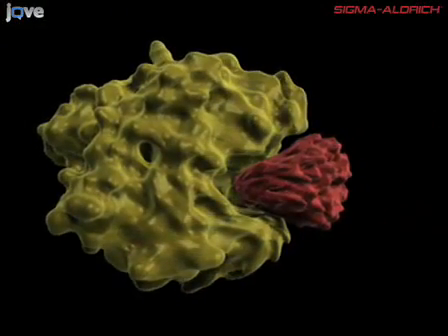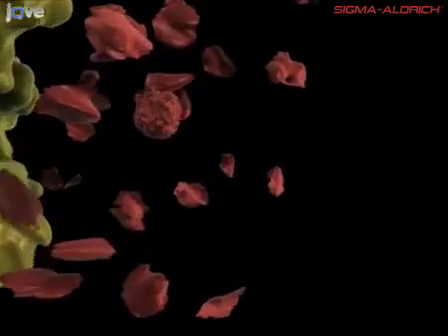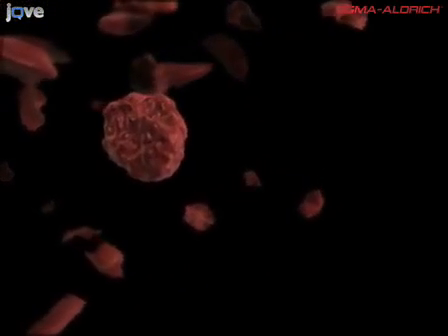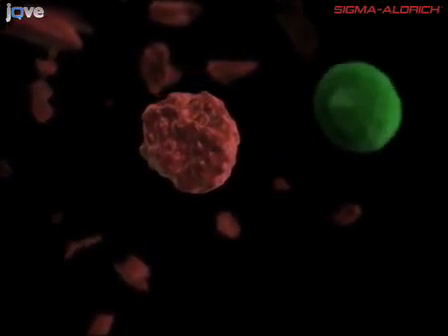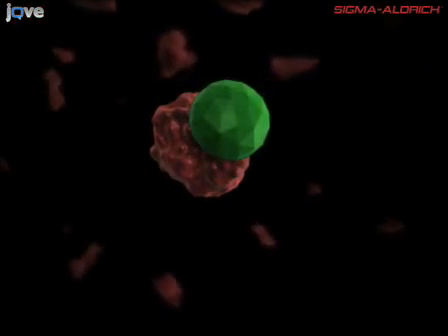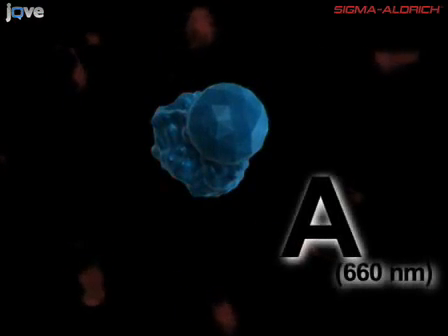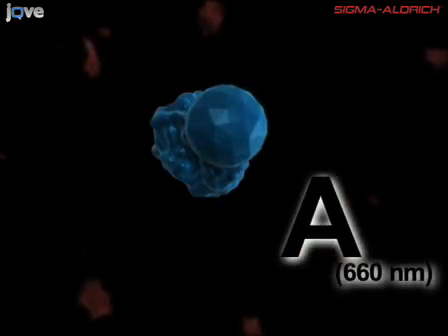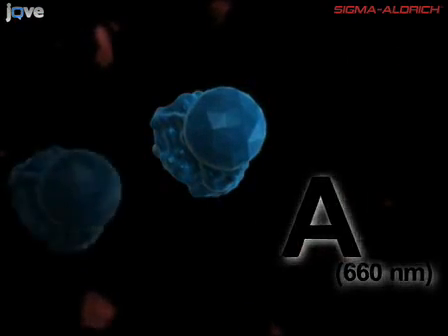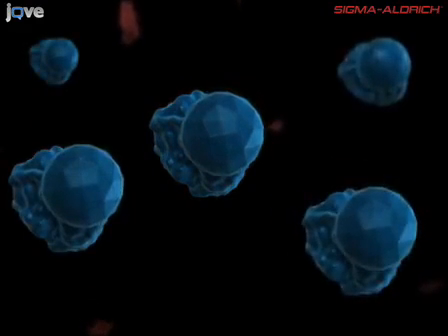In this assay, casein acts as a substrate. When the protease we are testing digests casein, the amino acid tyrosine is liberated along with other amino acids and peptide fragments. Free tyrosine then reacts with Folin and Ciocalteu's phenol, or Folin's reagent, to produce a blue-colored chromophore, which is quantifiable and measured as an absorbance value on the spectrophotometer.